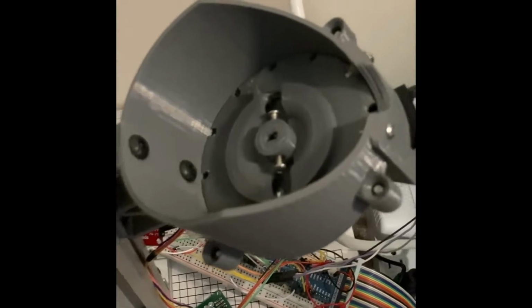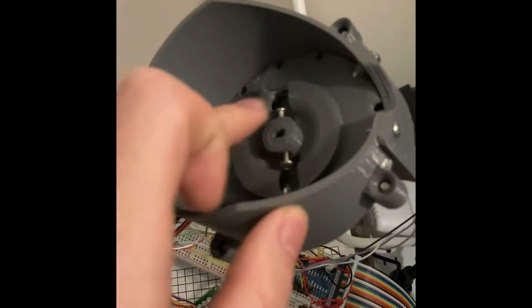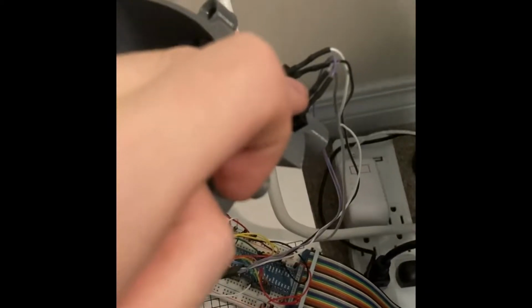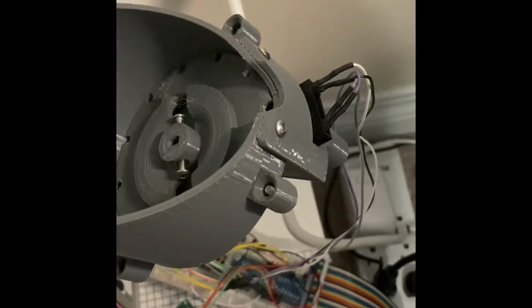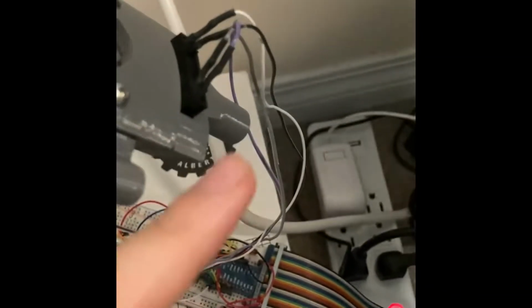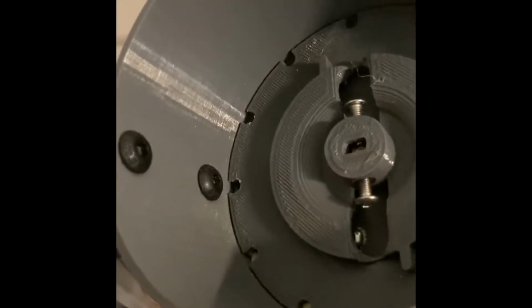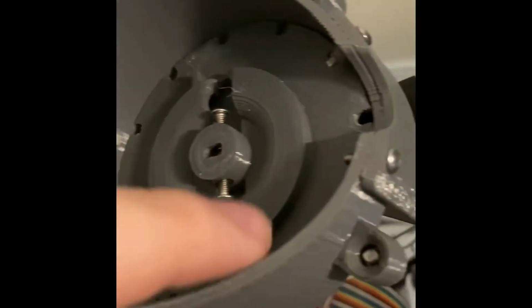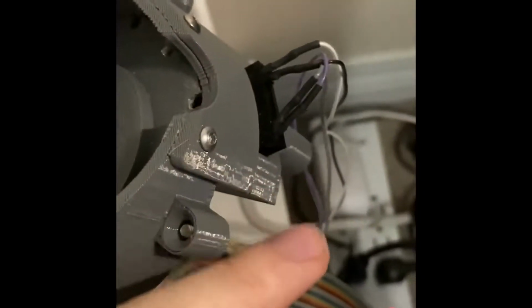Here you can see is our food dispenser. It has a rotating floor, a motor which drives the floor, and also an optical switch here. The optical switch is used to detect the food pellets dropped through this nozzle. You can see here are some small holes on the floor of this dispenser. These small holes will bring the food pellets to the nozzle and drop through it.